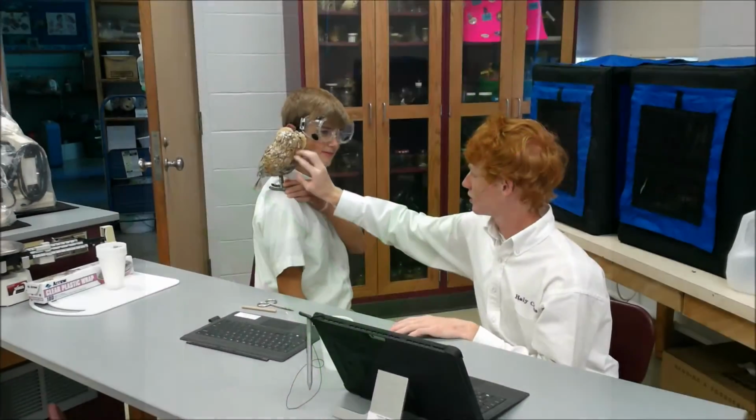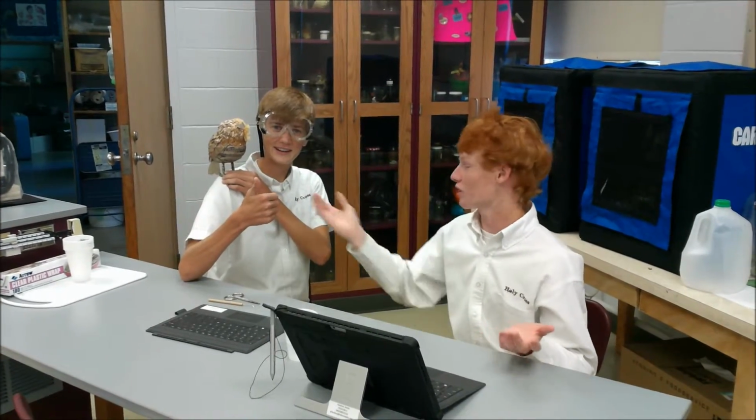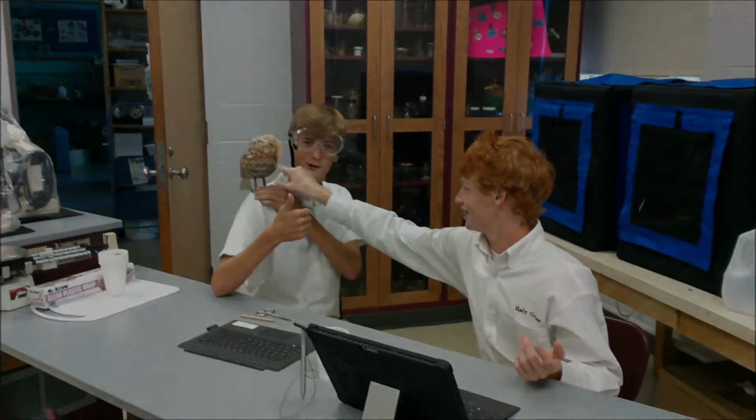Johnny, you're supposed to handle all living organisms in a humane way. Thank you. We want all living organisms to be protected.